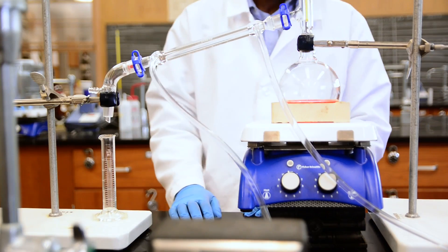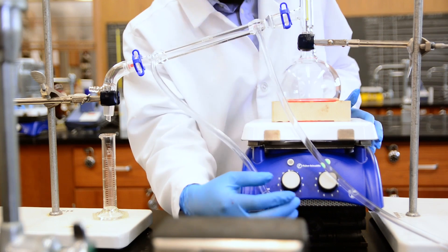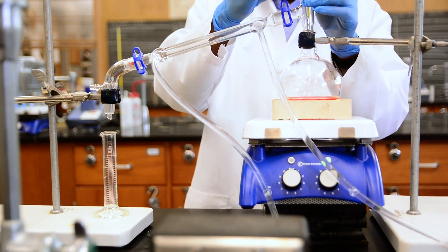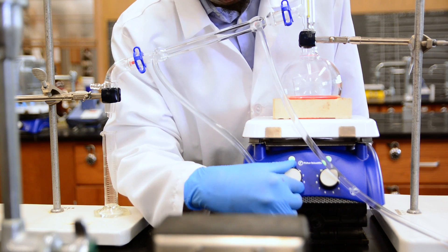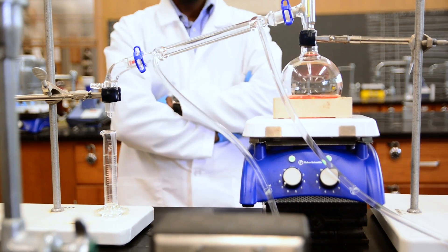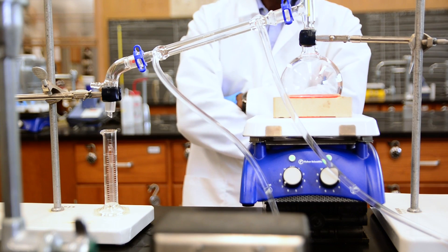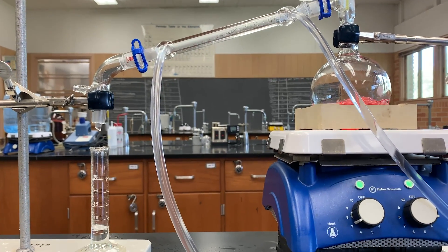Let's turn on the stirring function and start out by stirring the solution at a slow rate. You don't want to go too slow or too fast, so let's put this one at around 5. Be sure to experiment with your stirring function, as different instruments will give you different stirring speeds. We can then double check that everything is connected and that our water is running through the condenser. Now let's turn on the heater and turn it up to a medium level to get even heating. Do not use a high temperature because the solution will start bubbling violently when it boils. If that happens, lower the temperature or remove the heat source completely, and wait until everything cools down before you start again. Also, the discrepancy in the two boiling points is not enormous, so we want to make sure we don't heat to a temperature so high that both substances end up boiling. If you set up the heating and stirring correctly, the mixture should soon come to a nice even boil.